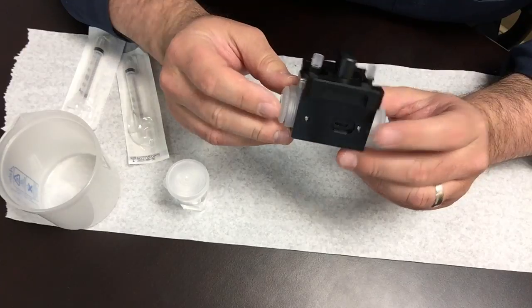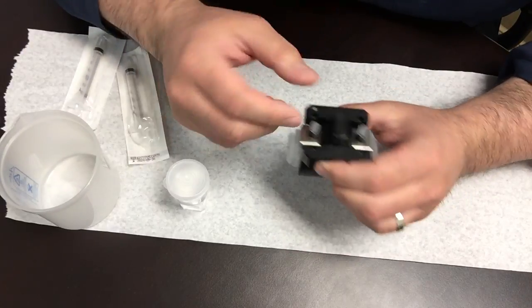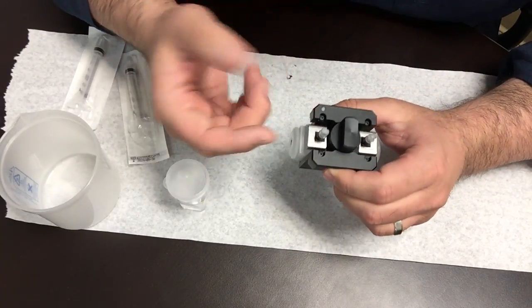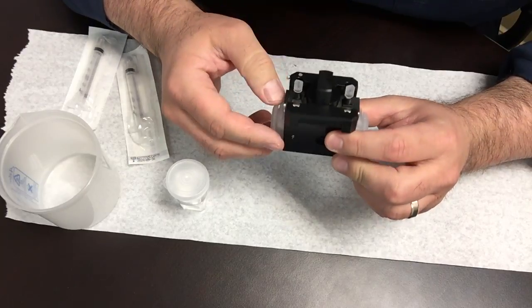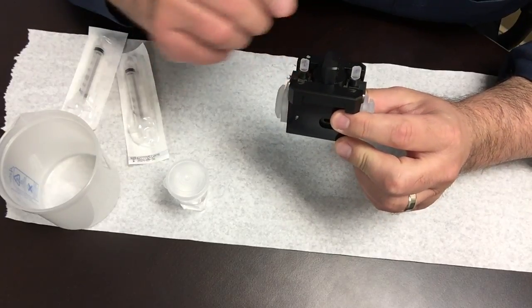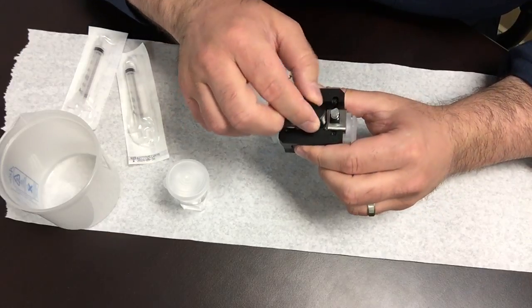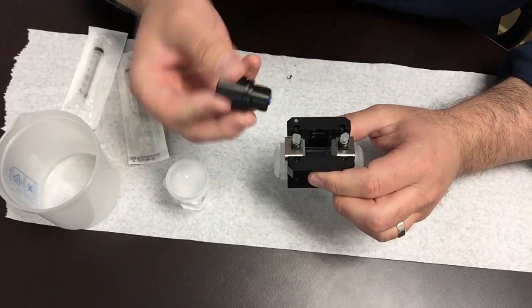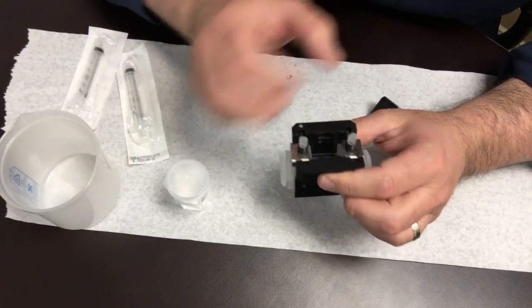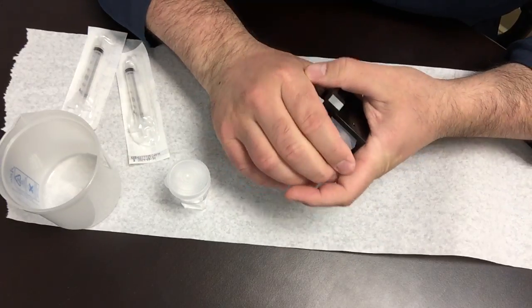It has parallel electrodes. I'm going to take this apart and show you all the different pieces and then reassemble it, and at the same time fill in the sample. So first thing, we're going to take the cap off. This is just a light blockage block and we pull this apart.